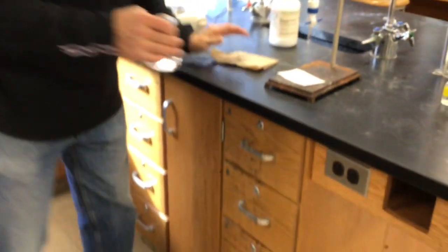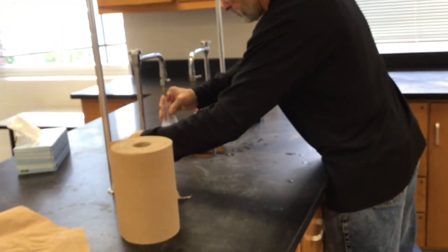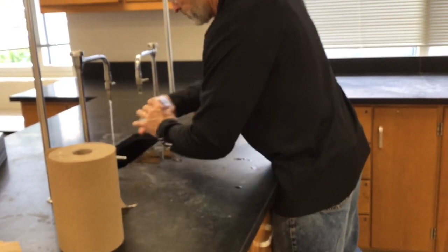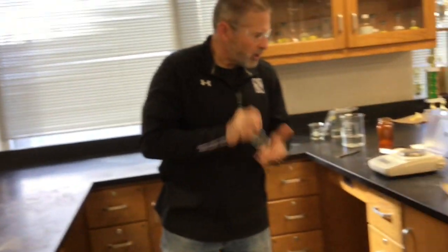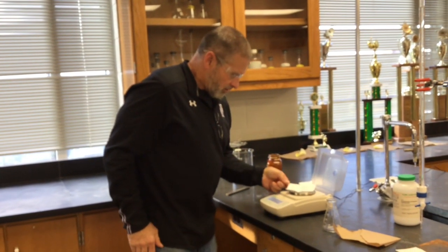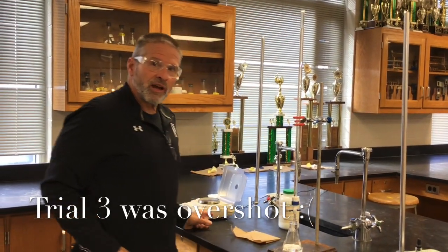Okay. All right. One more. Now, you're not trying to identify who this acid is. That's really impossible from the information you have. We're just trying to figure out its molar mass. And the mass was 0.171.